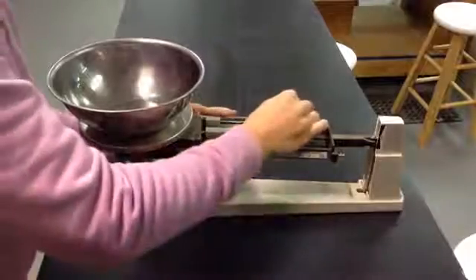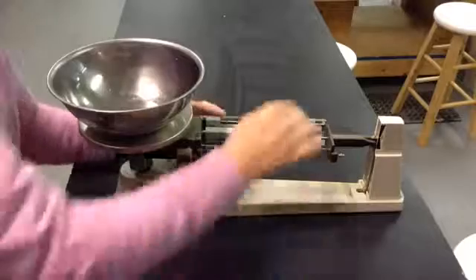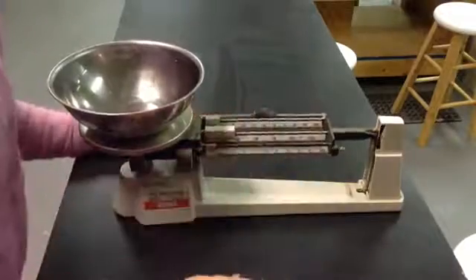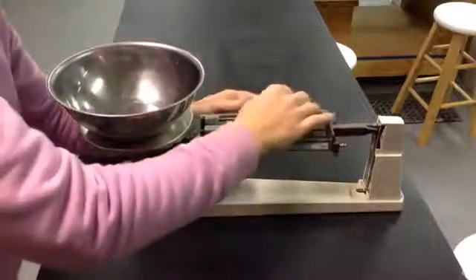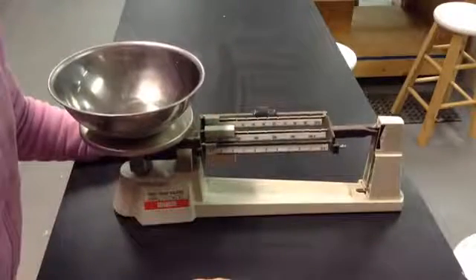continue making small adjustments until the beam starts to move. Once the beam starts to move, you can make smaller adjustments to get it closer and closer to reaching the zero.